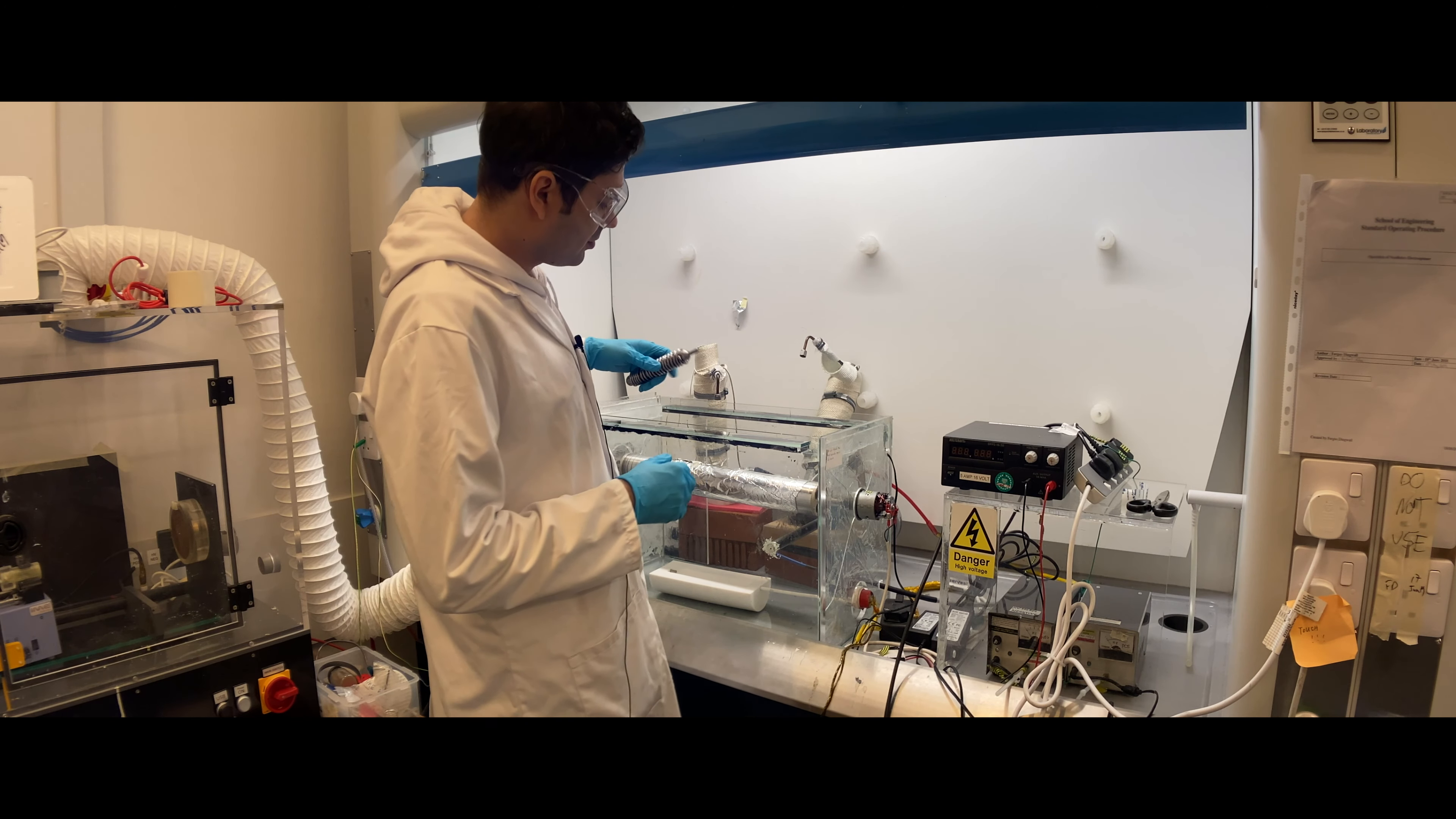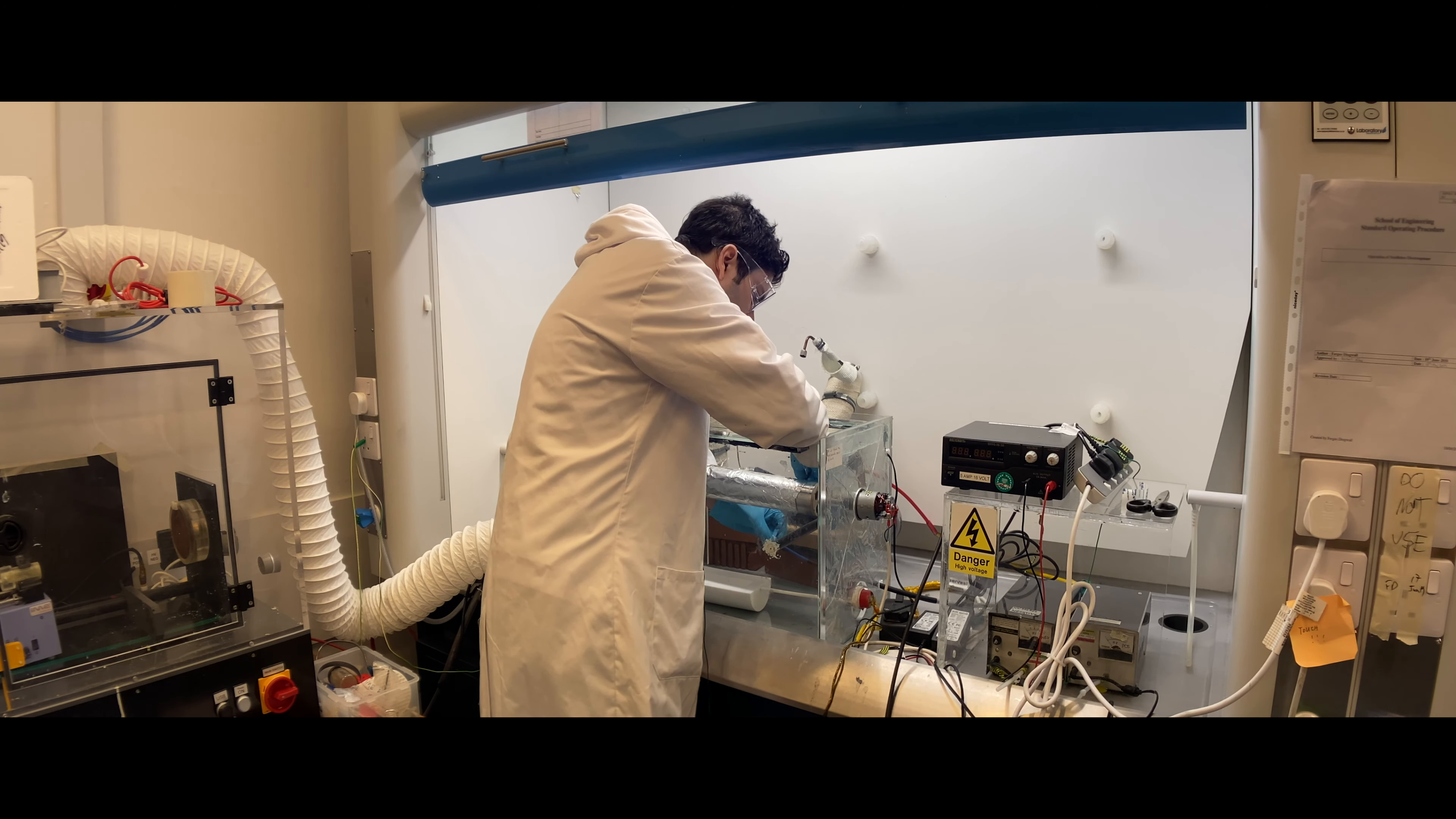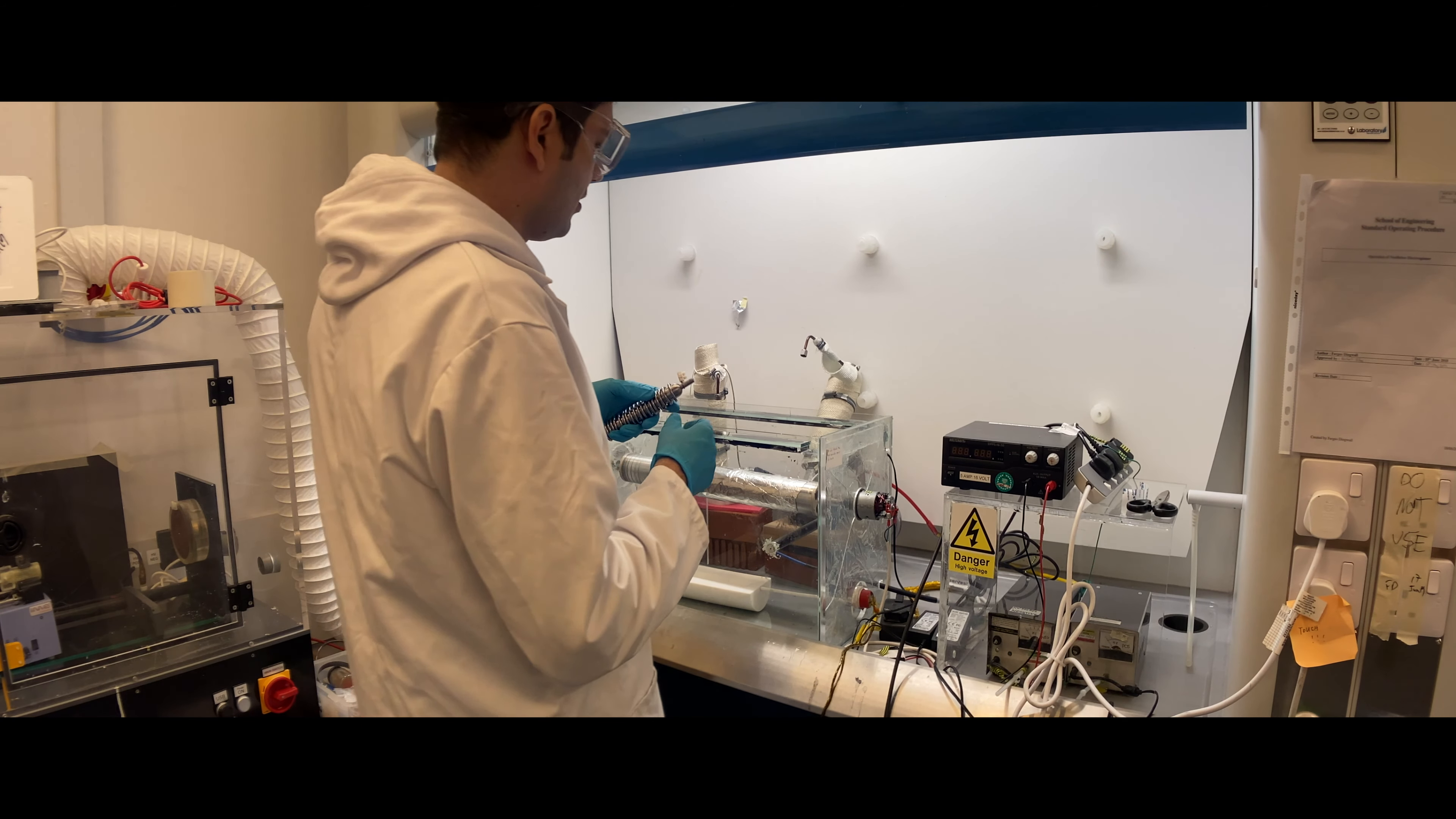Then you can take the electrode and put it through this loop. This loop is giving the positive high voltage. The shaft of the electrodes are different in sizes, so you might need to adjust the inner diameter of this loop. You can do it simply by twisting it a few times into the correct direction to make it smaller or bigger. Best is to take it off with a screwdriver from this high voltage lead, then you can make sure you can adjust this copper loop to the size of the electrode.